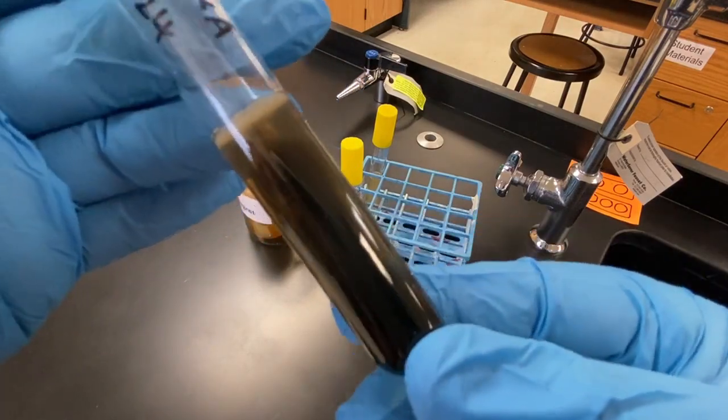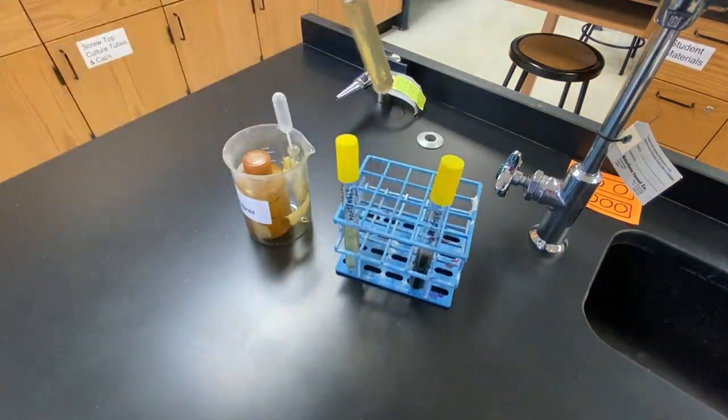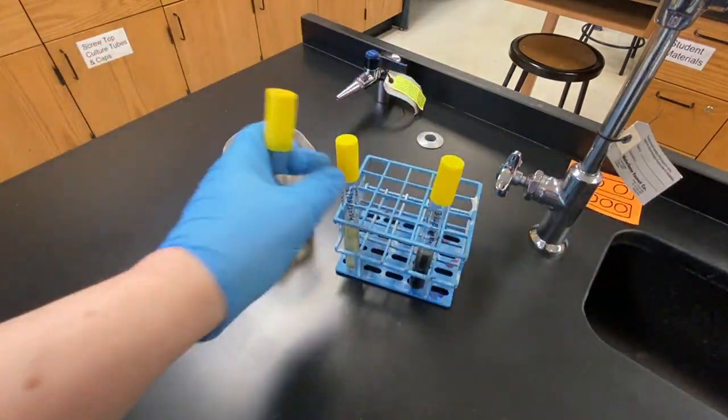When trying to assess motility, it can be useful to compare the incubated tube to an uninoculated tube. Here, the tubes have just come out of the fridge, so I am wiping off condensation.